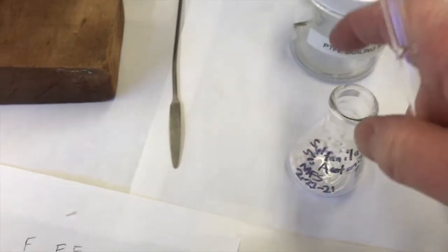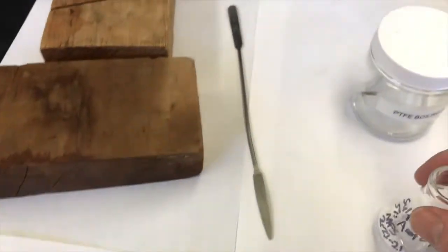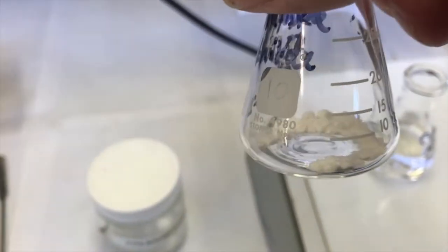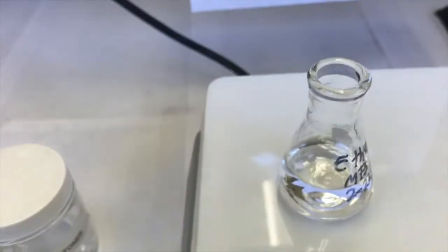So what I want to do is put this flask on the hot plate as well, so it can be heated while I'm adding the hot boiling ethanol. Do I though want to put this solid sample in the glass on the hot plate now when there's no solvent in it yet? I do not, because a solvent boiling in a flask really cools down the glass of the flask.